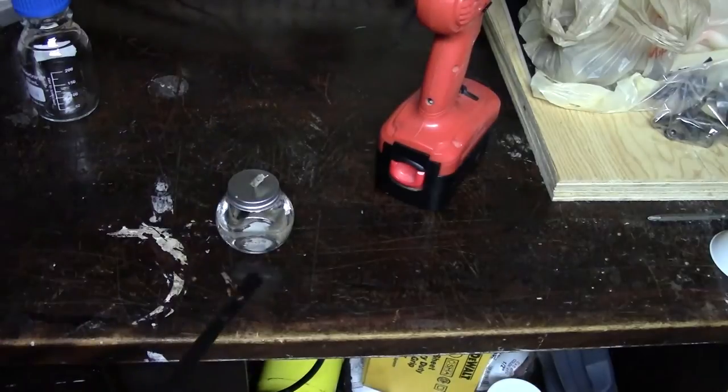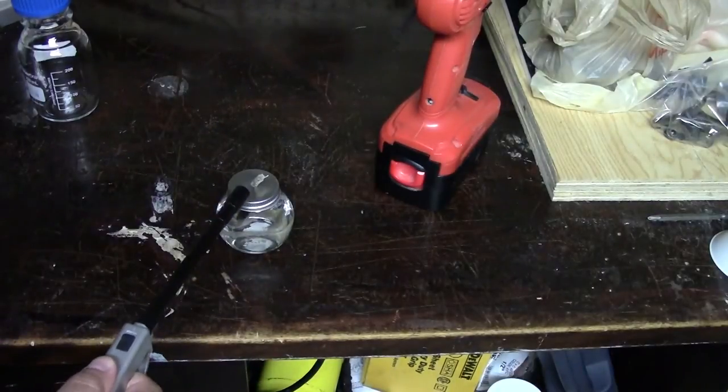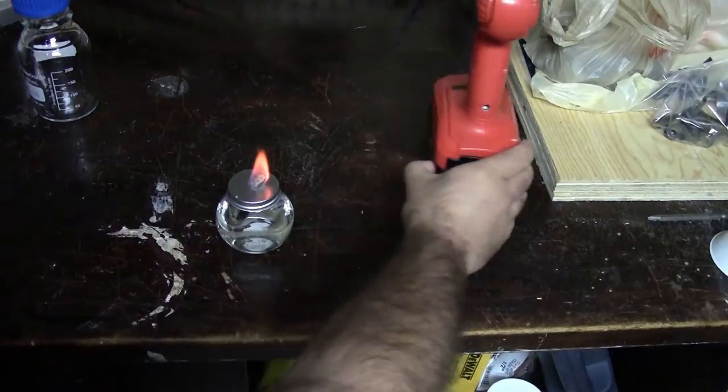And once that wick is damp, you can light it. And there's your alcohol lamp.